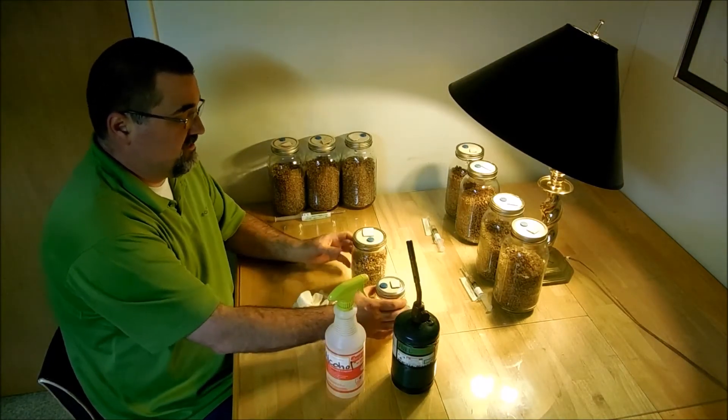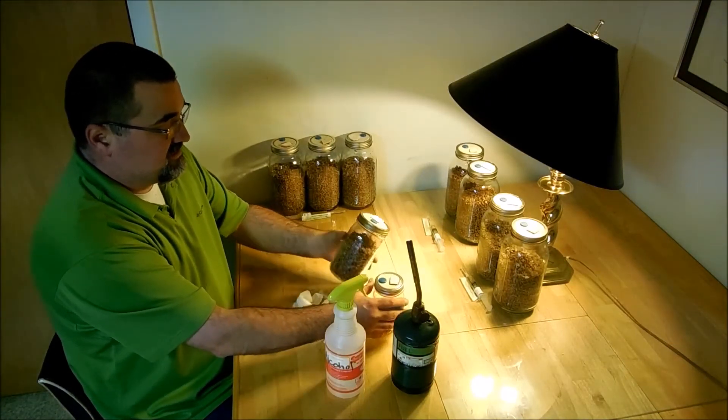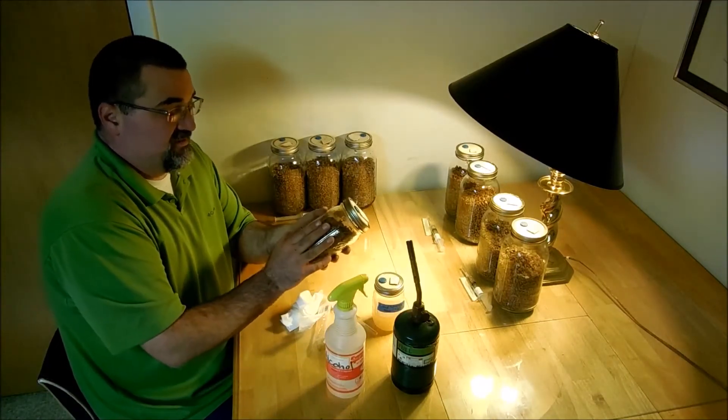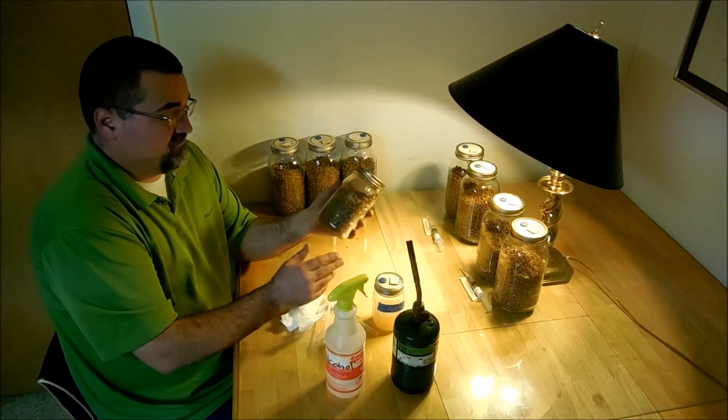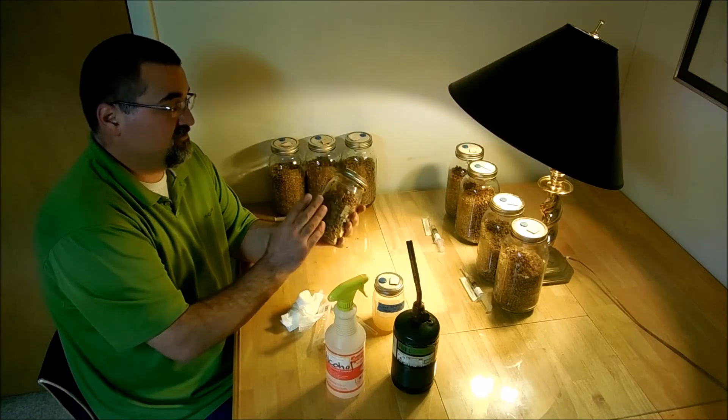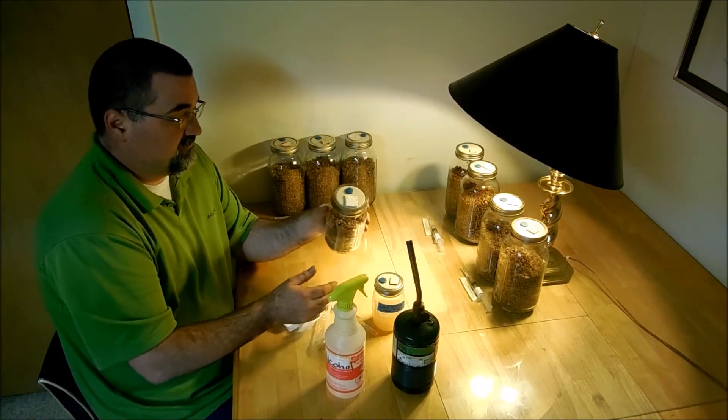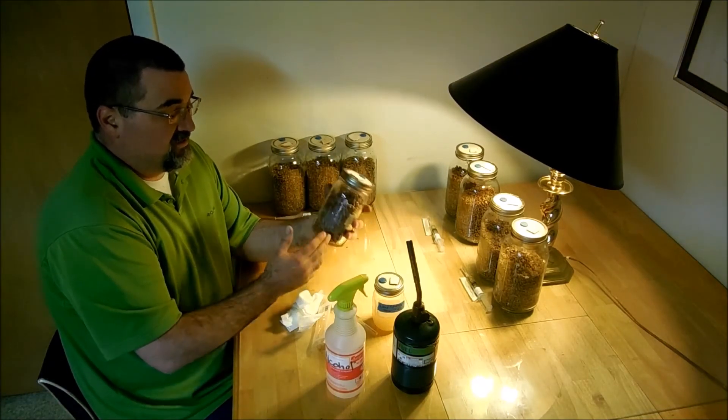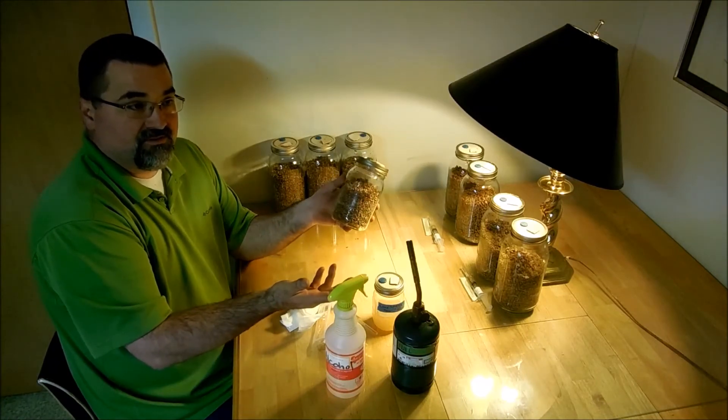So now what I'll do is set these aside and see if anything unusual grows in here. Make sure what grows is actually mushrooms. And then once it's fully colonized, I'll throw it on some straw, see what the mushrooms look like.